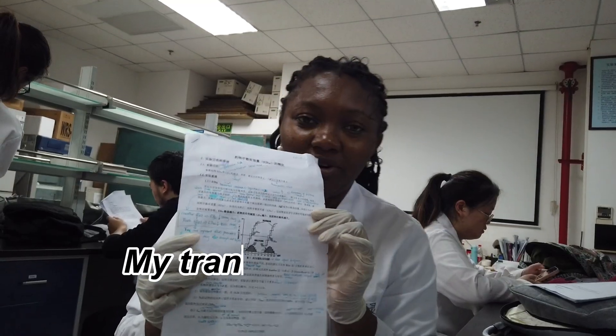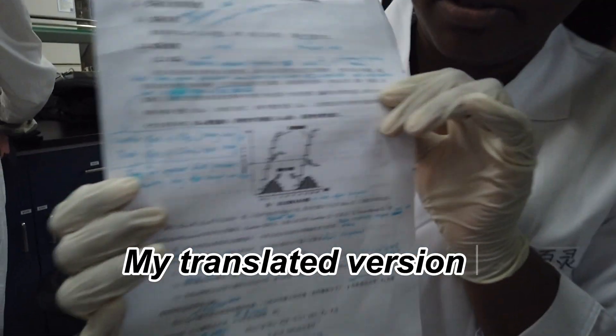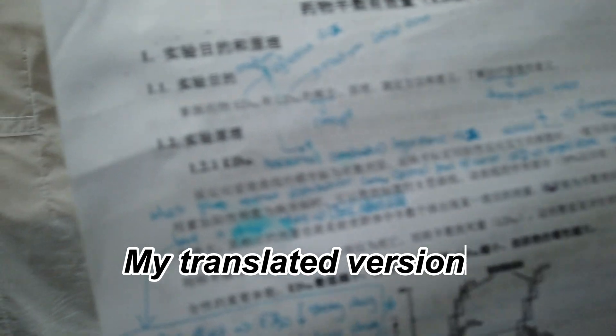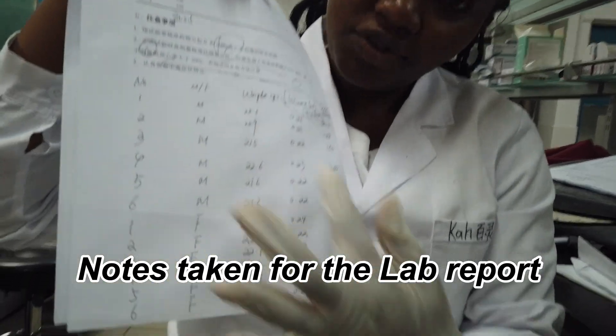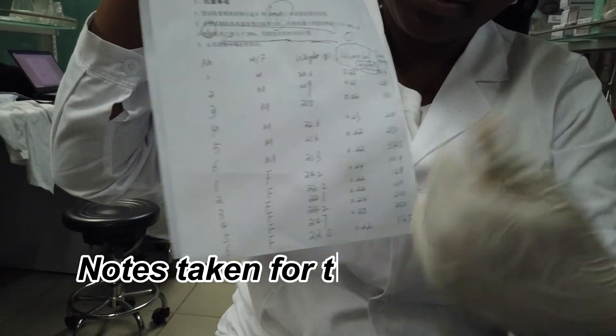You understand what we're going to do? The protocol? Some notes we took during our last experiment.